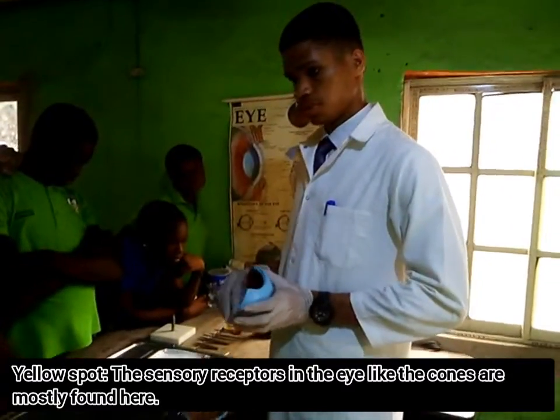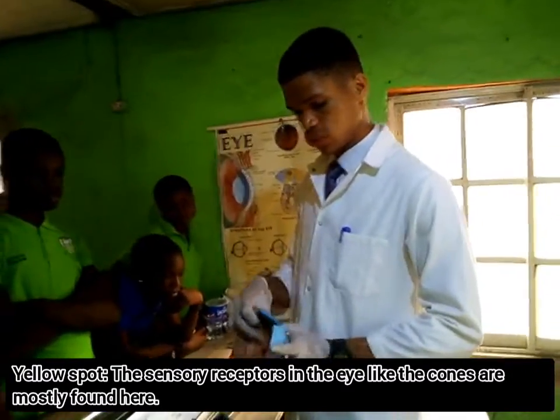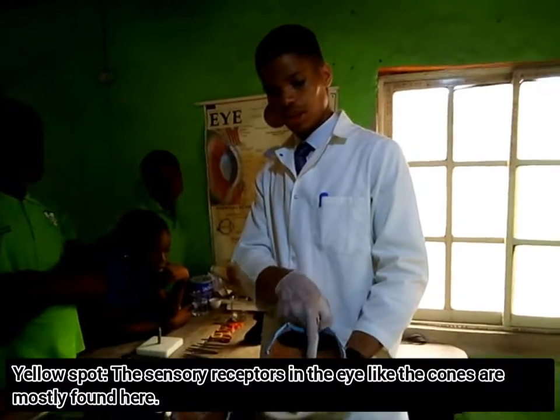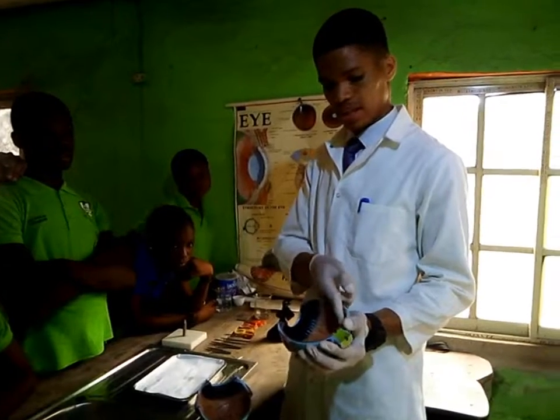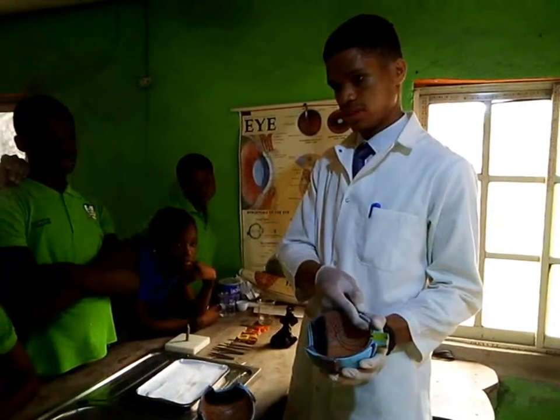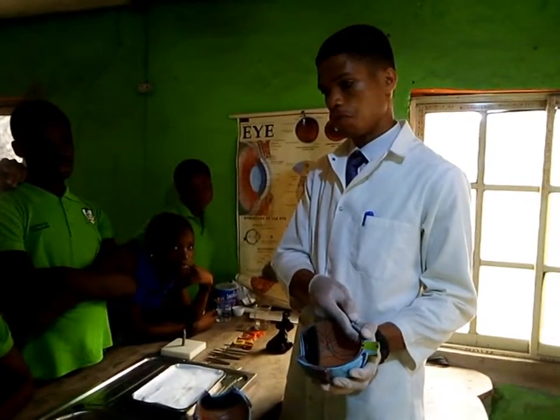Mostly the cones. You get that? And this is where light is positioned. You can see it here. Now the light is coming. The light ray is refracted and it strikes this place. It strikes at this yellow spot, or what we call the fovea centralis.